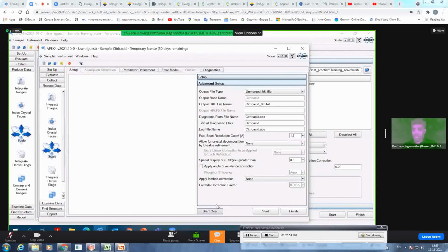Then under advanced setup, you can make an output file directly into an unmerged HKL file, merged HKL file, XD format, or modulated format for JANA. So you can make the HKL file directly from here. So now let it be by default. And then, if you know, in integration you included the fast scan, and now the reflections you are taking back from the fast scan are used during the scaling. So for that, the resolution cutoff you have put is 1.5.